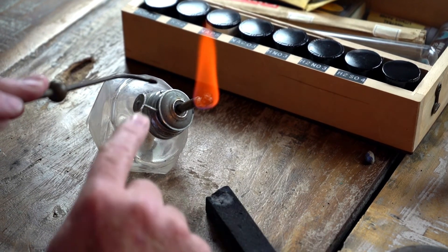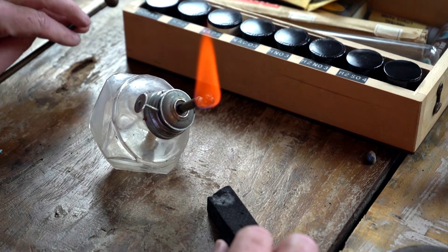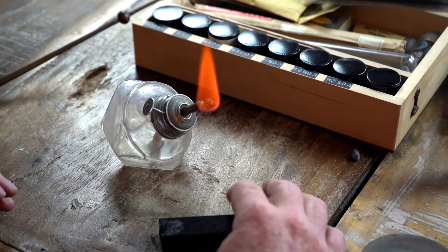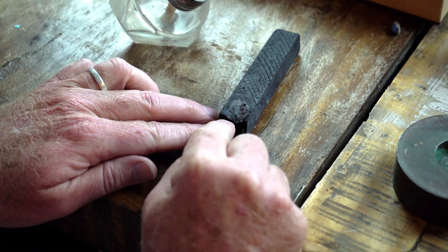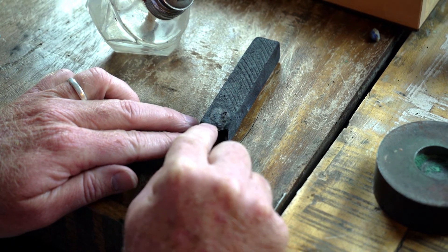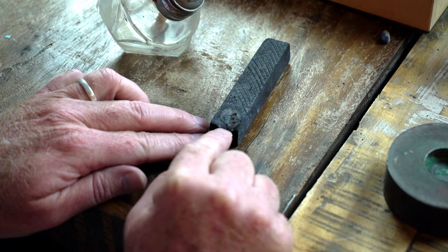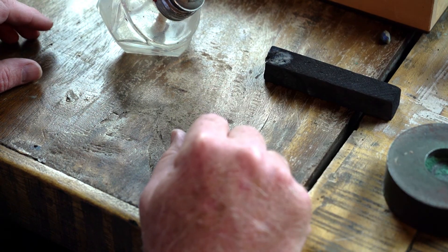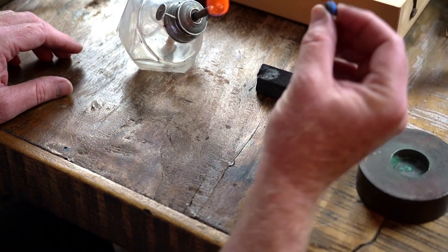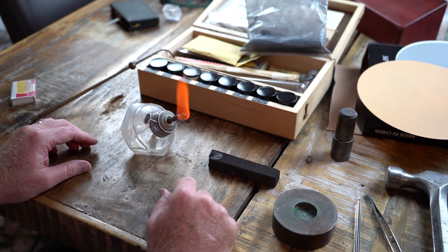You can see right here where this was in the flame — it was turning green. That's the copper in here burning off a little bit, so that tells us it's made out of copper. And now as this cools, it will develop a green ring around there. Some of it probably didn't show up on the video very well, but right along the bottom here there were little green particles. Green always tells us it's copper, whether you're using a blue mineral like azurite or a piece of malachite, which is what I pounded up — it will always burn green like that.